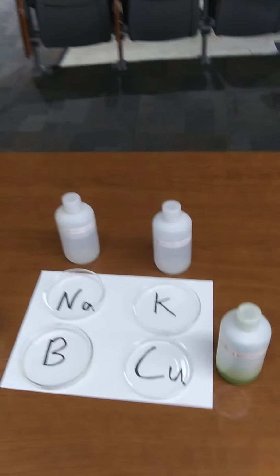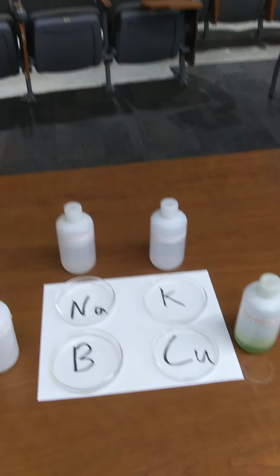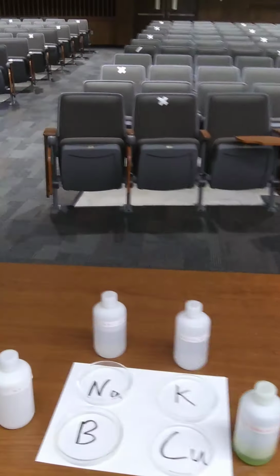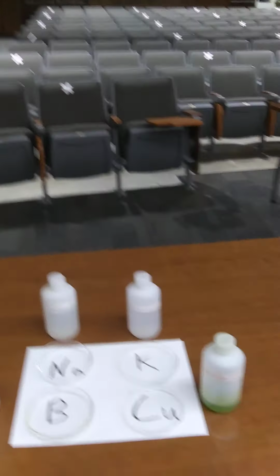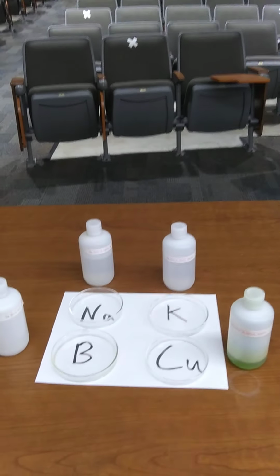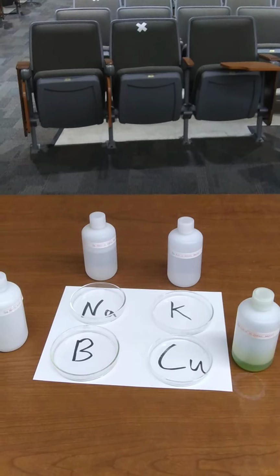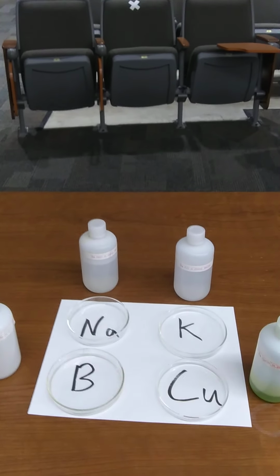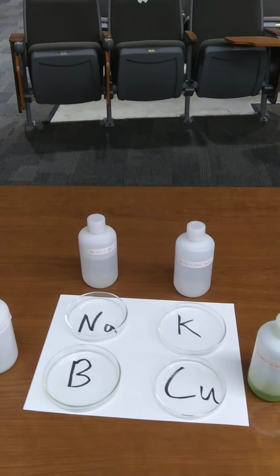Hi everyone, I'm going to do a demo and we'll see how well this works. I'm feeling this is the classroom we're normally in, so it's kind of hard for me being here to tell you the truth. But a lot of students said they liked the demos and we'll pretend like we're in class together. So what I've got here are solutions of sodium, potassium, copper, and boron.